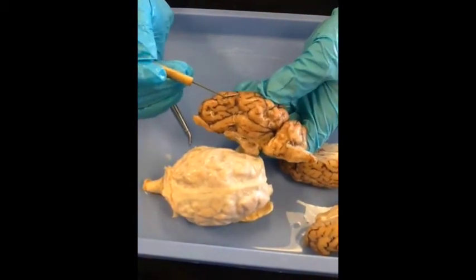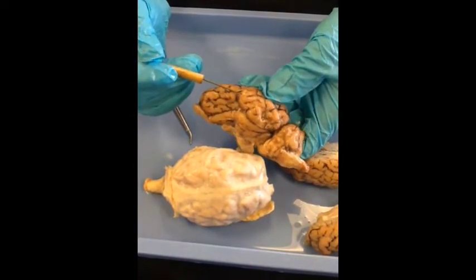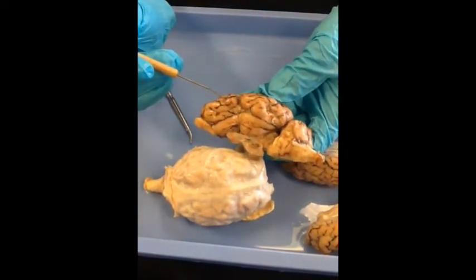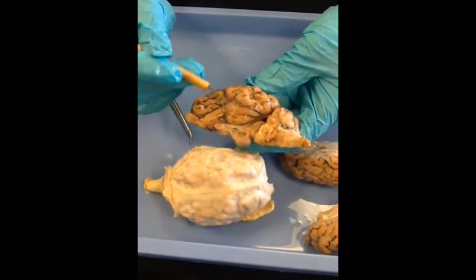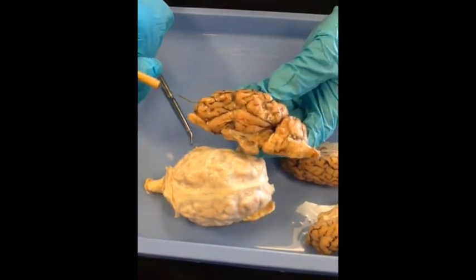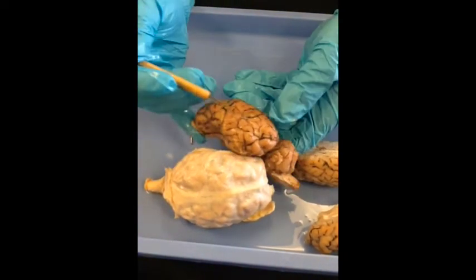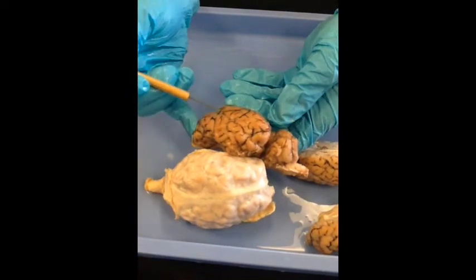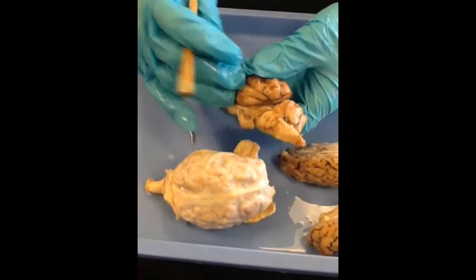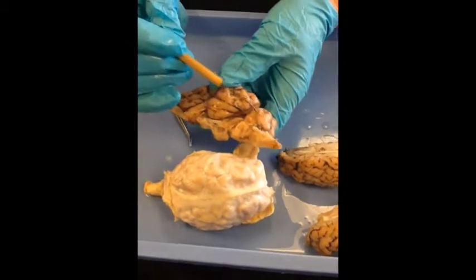This shiny layer is your arachnoid meninges. The brown is blood vessels. You can identify the temporal lobe, frontal lobe, occipital lobe, and parietal lobe on the very top. And here is the cerebellum.